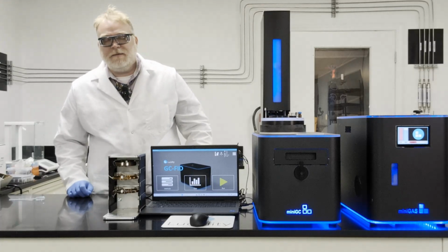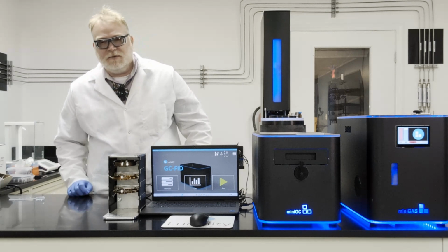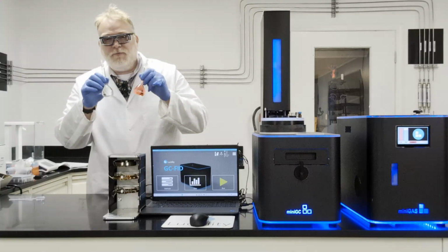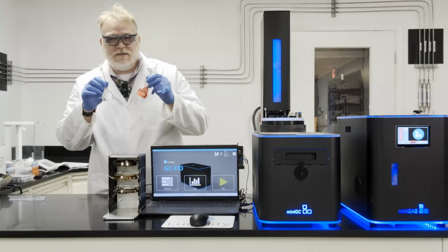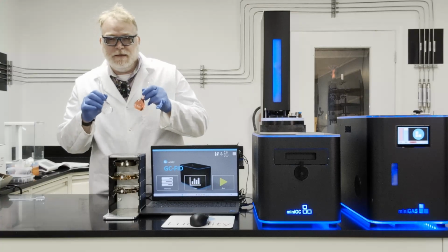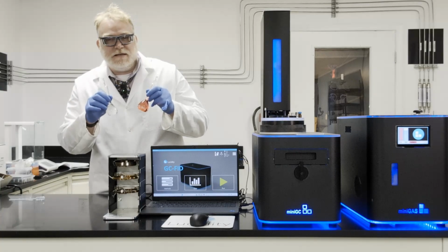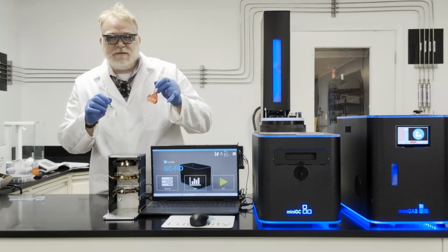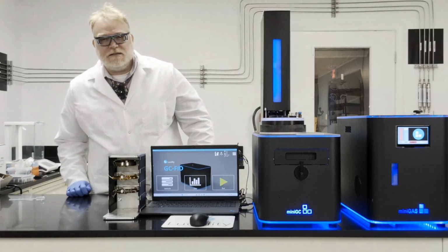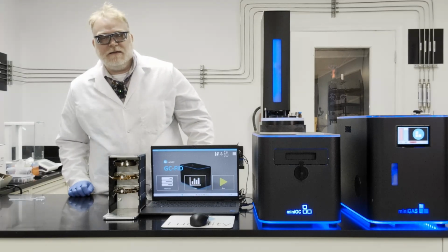Next, it's time for the samples. The sample preparation wasn't too difficult as everything's soluble in methanol. So each sample was diluted to about a concentration of 0.4 milligrams per milliliter for two reasons. One, to fit the calibration curve, and two, not to overload the column. Now that the samples are in solution, I'll just vial these up, load them onto the auto sampler for analysis. I also am going to have a blank methanol and the three concentrations of the mixed standards, starting from the least concentrated to the most concentrated. Then the three samples.